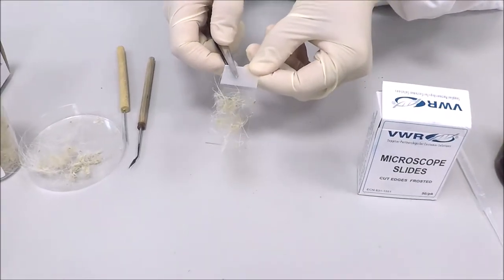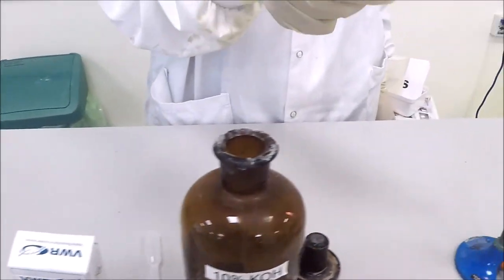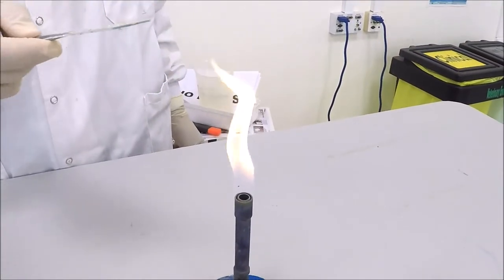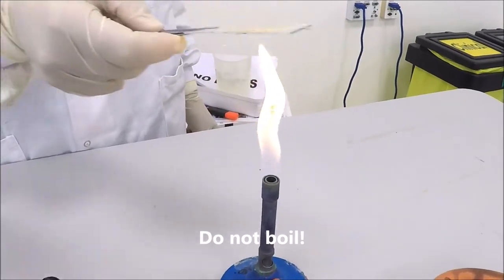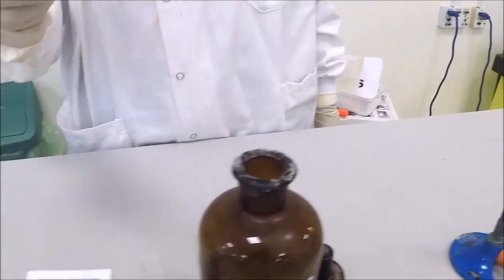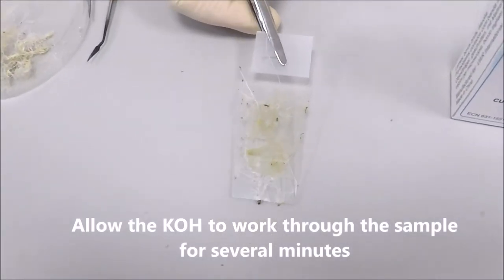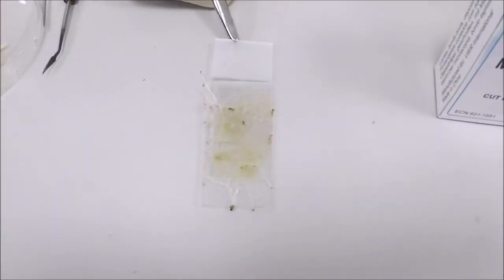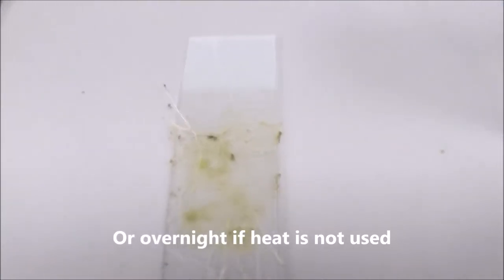Taking your forceps and slide, place the slide through the Bunsen flame for two to three seconds. Please ensure that you do not boil the sample. Allow the KOH to work through the sample for several minutes, or overnight if heat is not used. We will not be using heat in this practical today.